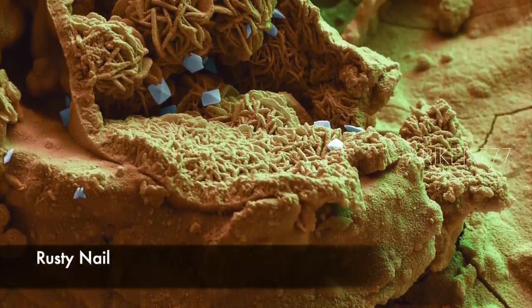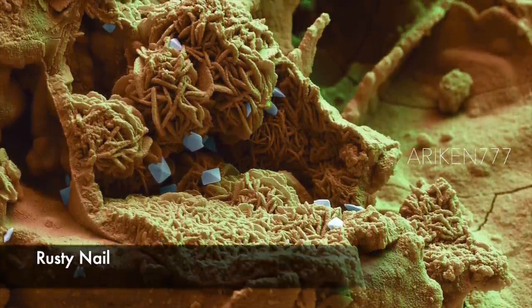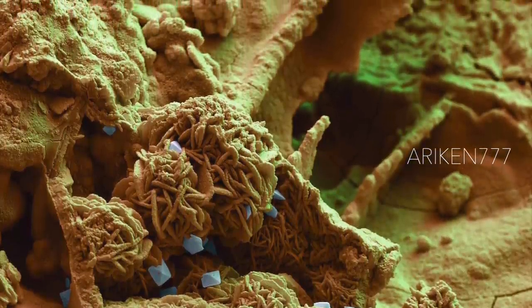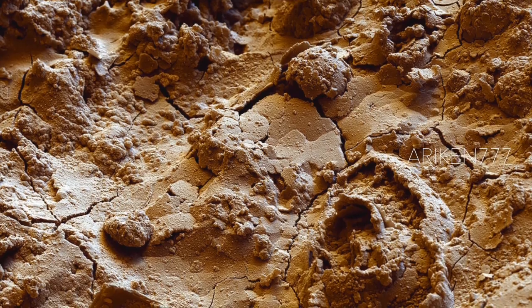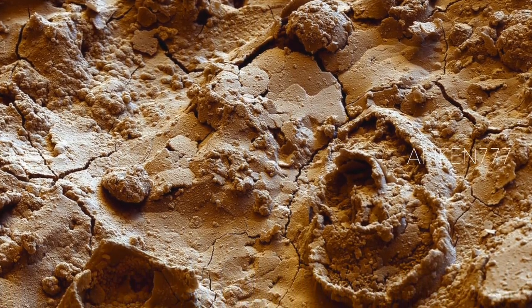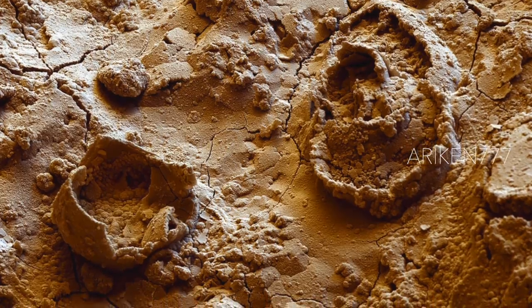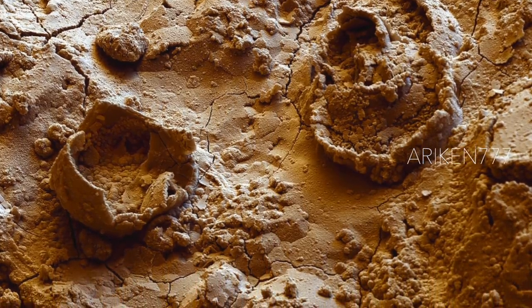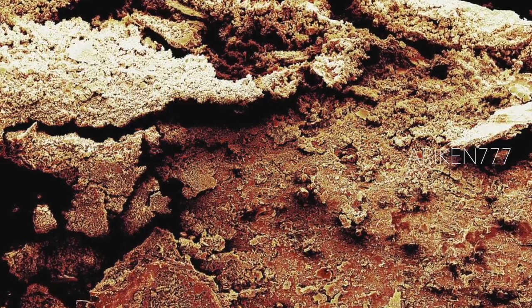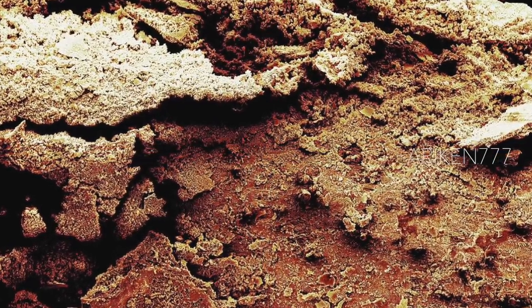The tip of a rusty iron nail. Rust is hydrated iron oxide and results from a reaction between iron and atmospheric water vapor and oxygen. This corrodes and weakens the original iron structure. The flaky structures seen here are bits of rust that are coming away from the nail.